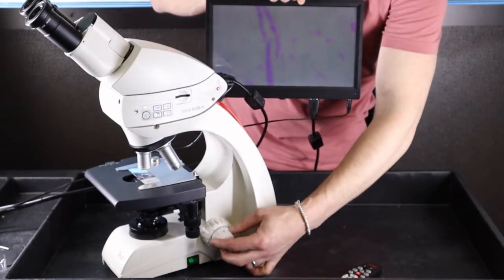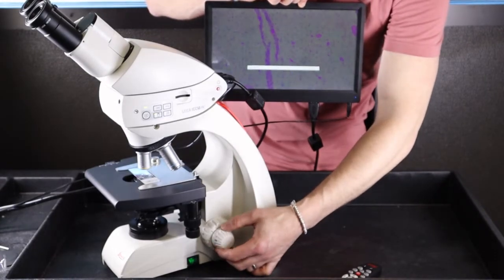As you see here, I'm focusing. I have a live, real-time image.